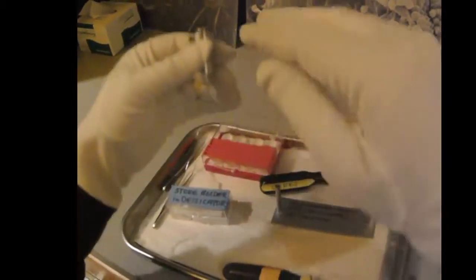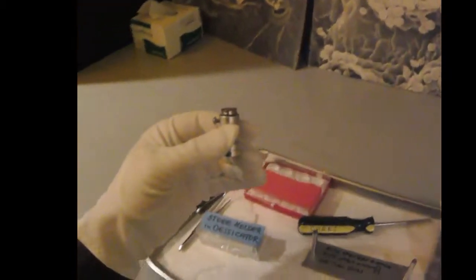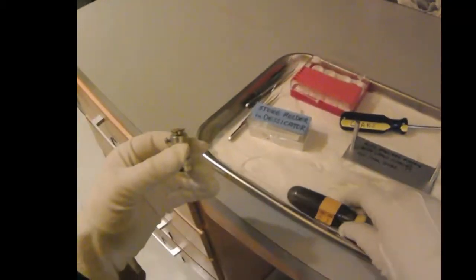And sample height is important because it needs to be low enough to clear the detector but high enough to be in the focal range of the instrument.